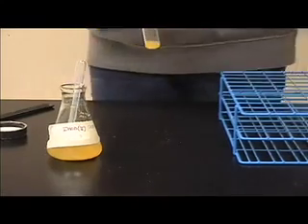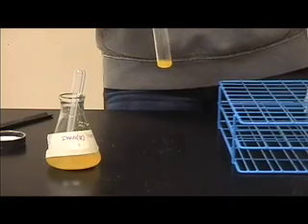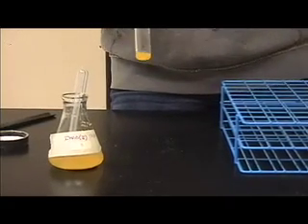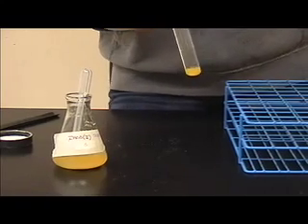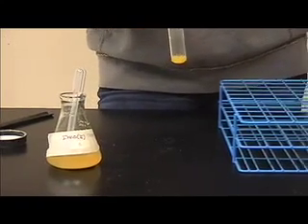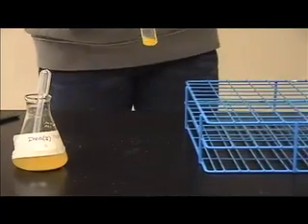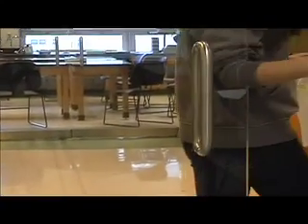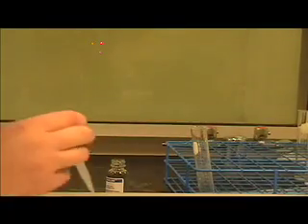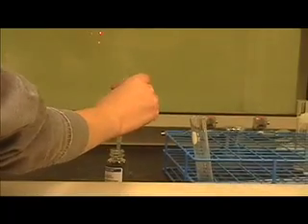Now, the next item we're going to be using is concentrated sulfuric acid. Now, this sulfuric acid is extremely, extremely dangerous. I cannot stress how cautious you have to be with this. So we're actually going to go into the fume hood just to prevent any accidents from happening. So, here we go. So, we're going to get a few drops of this sulfuric acid. Make sure to keep the test tube in the rack so you don't get any on your hand if you're holding it.